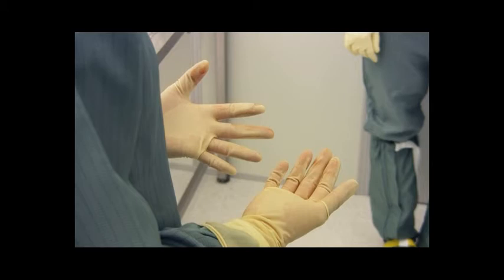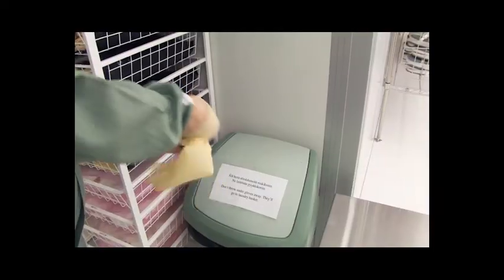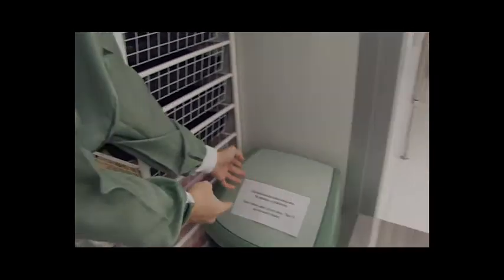Ensure that your gloves are clean as they can quickly spread impurities around the cleanroom. You can change your gloves as often as you consider necessary.